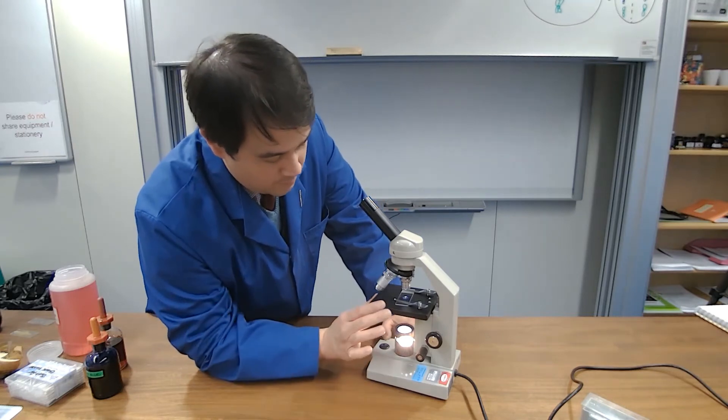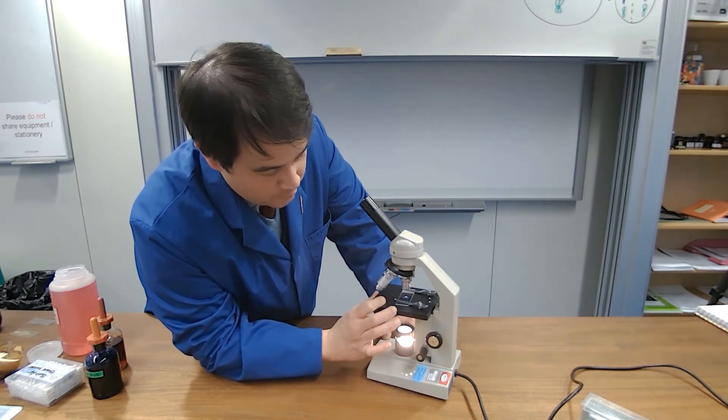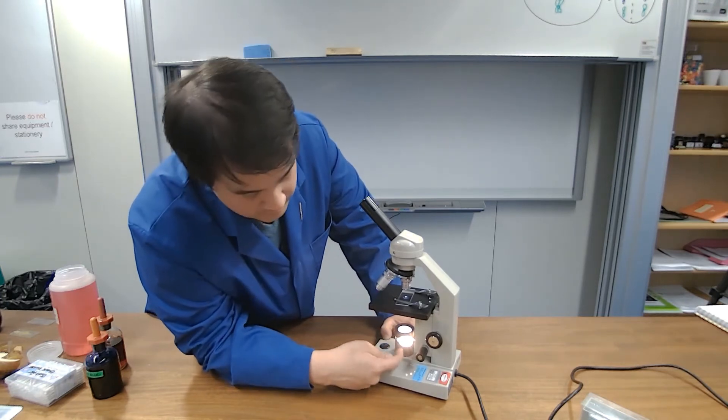Other fun things to do with the microscope - you then have a diaphragm control here where you can control how much light is being let through your stage from the light source at the bottom.